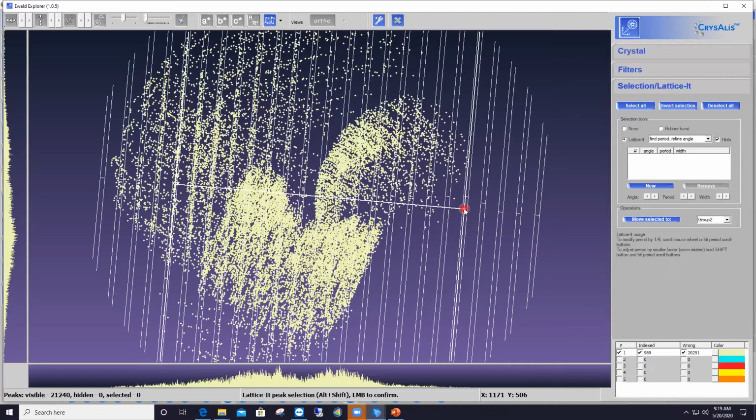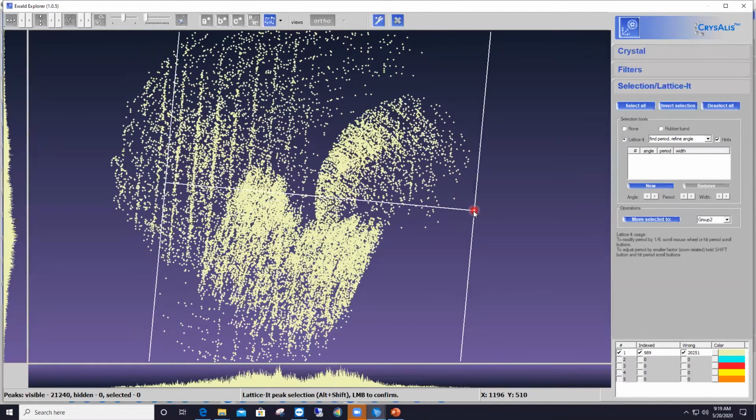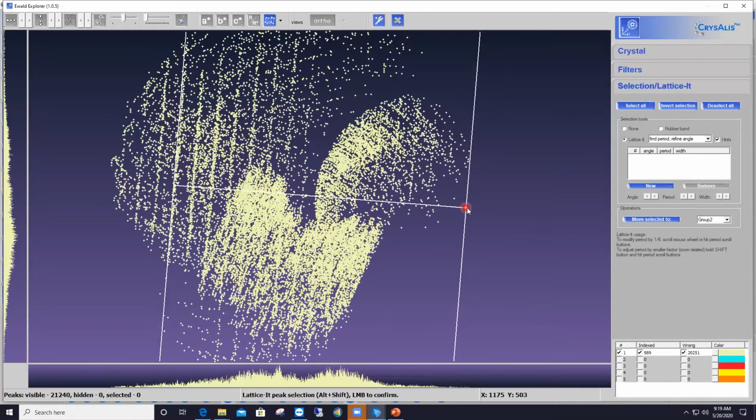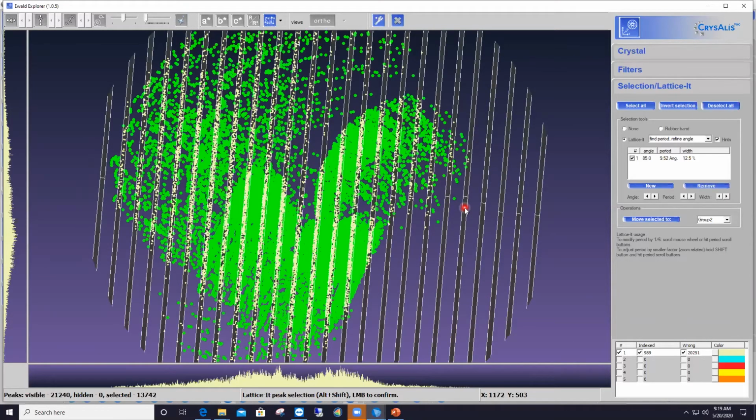Now, at this point, nothing is set in stone yet, because if I move my cursor, then the orientation of those lines changes, and then everything is broken. Okay, so let me do that again. Align my cursor with one of those rows, and now I'm going to freeze up the view by clicking once more on the left mouse. And now you remember the view that I showed you in one of my slides previously, whereby red bars have been drawn on top of rows of reflections, and whatever reflections have been left outside of those rows are now highlighted in green, ready to be moved to a different group. And that's all that needs to be done. This is how Lattice-It works.